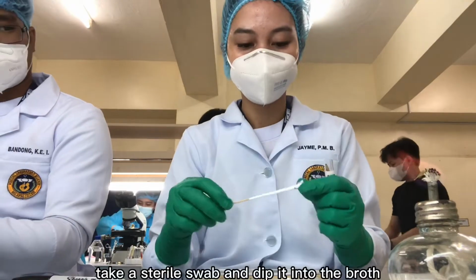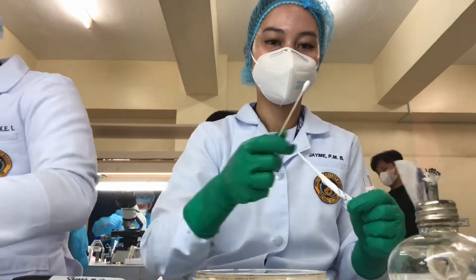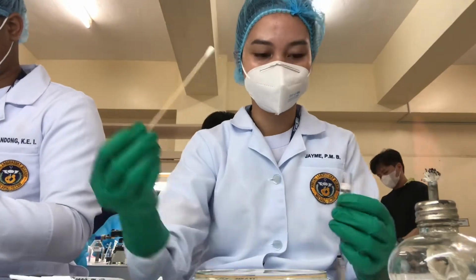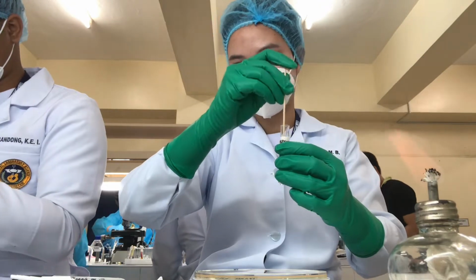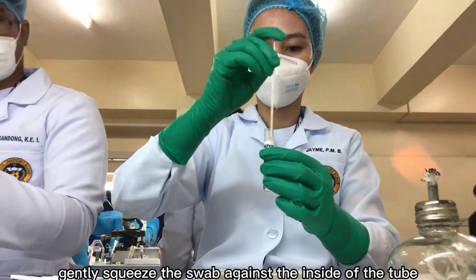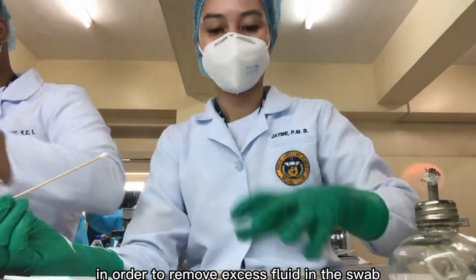Take a sterile swab and dip it into the broth culture of the organism. Gently squeeze the swab against the inside of the tube in order to remove excess fluid in the swab.